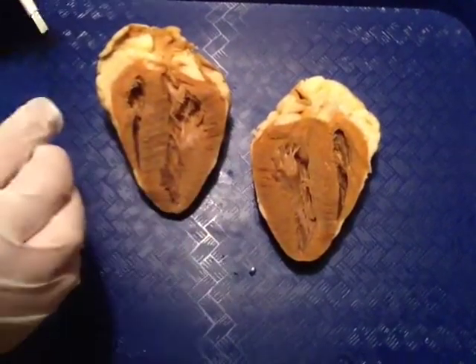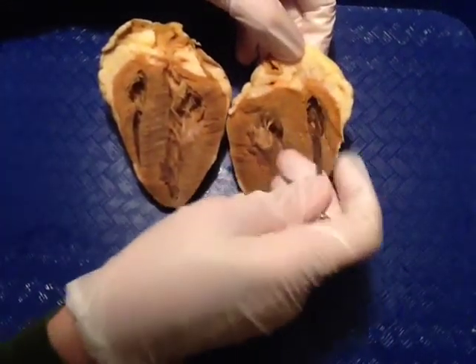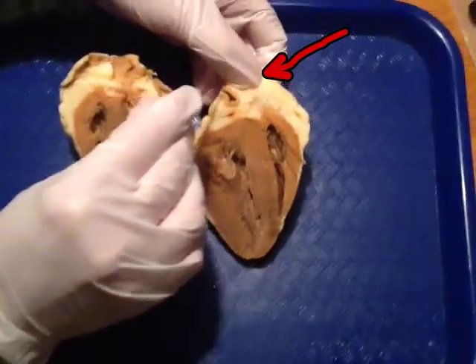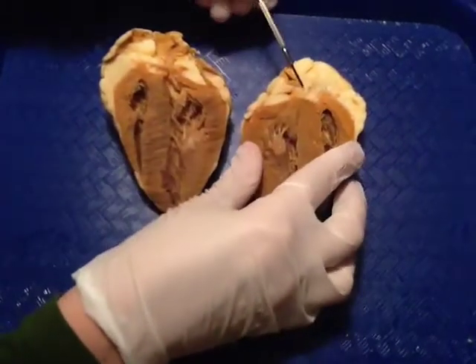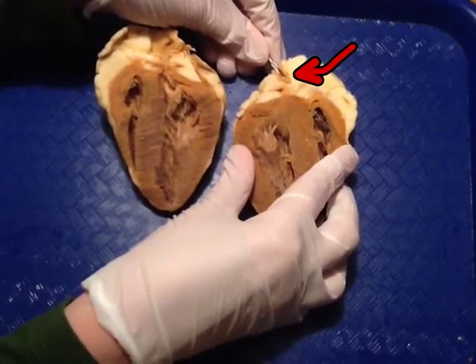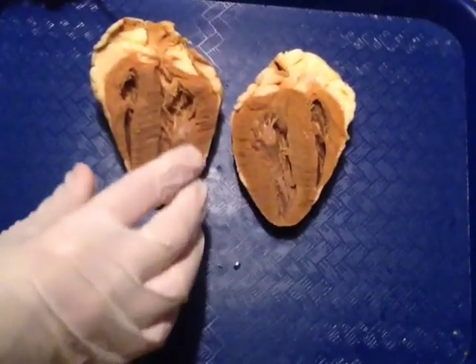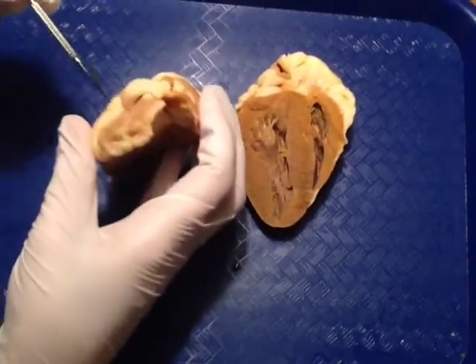The fourth major blood vessel is actually better seen on this side of the heart. Again, we're looking at the right side. If you look right here, we have our fourth major blood vessel, which is the pulmonary artery. The pulmonary artery travels into the right ventricle. We have the pulmonary artery which leads into the right ventricle. Also on the right side, we have the vena cava.